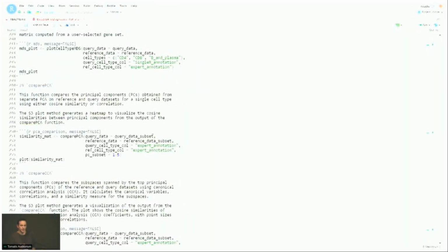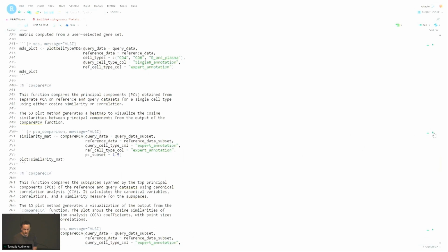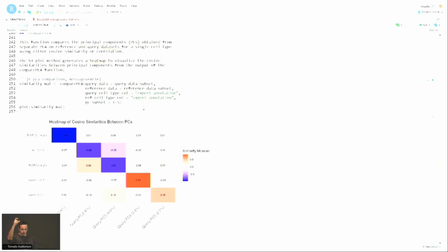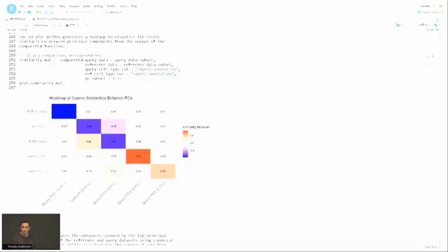Now, for example, if we want to look at a specific cell type, for example, CD4, we can compare the cosine similarity between the principal component vectors if we run PCA separately on the reference and on the query. So if things are well aligned, what we would get is kind of this perfect diagonal between the reference and the query. So here you can notice I'm using the expert annotation. So things look pretty good, well aligned, right? If I were to switch to the single R annotation, you can do it, but you'd have to change how you subset the data at the beginning of the vignette. Then you would see that you wouldn't get this sort of nice behavior for this heat map.